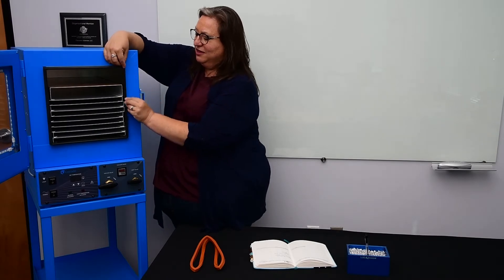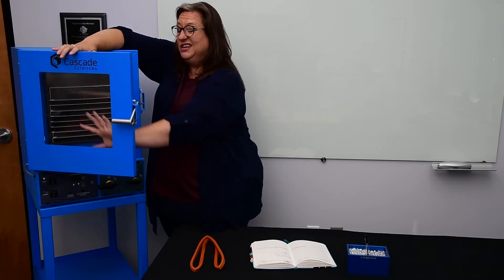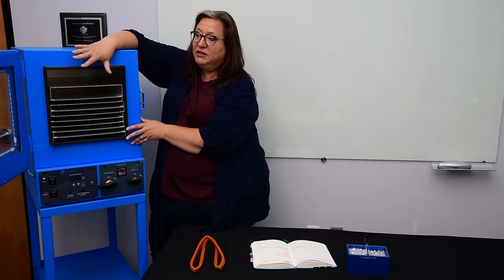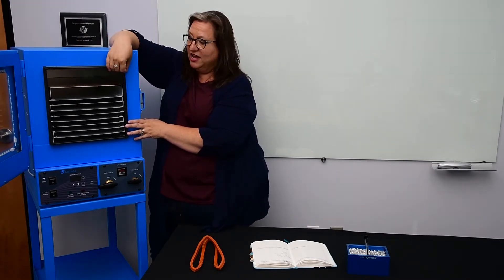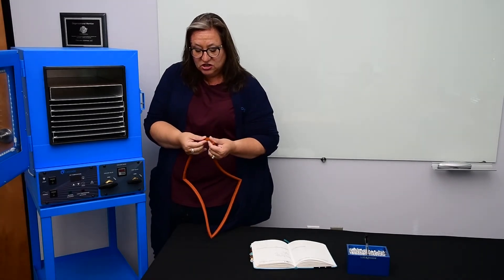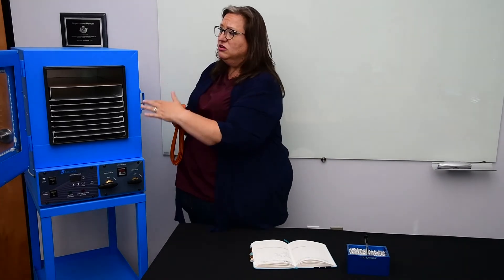The important thing to know: if you start seeing streaks on the front of your oven or anything building up, you want to keep that glass immaculately clean. That's going to be the most intimate contact with this gasket, and keeping the glass clean and condensation-free is the number one way to maintain your gasket. Number two is regular inspection of a cold gasket — looking inside as I demonstrated to make sure there aren't any cracks or areas that are thinning. And general hygienic cleanliness — making sure that we're cleaning any spilled solvents or terpenes very quickly.